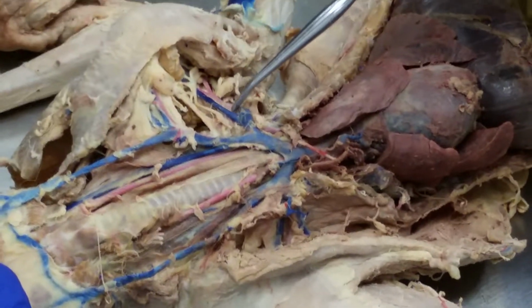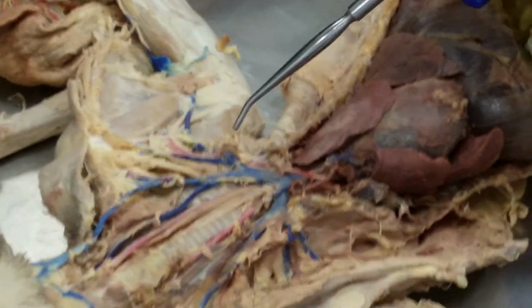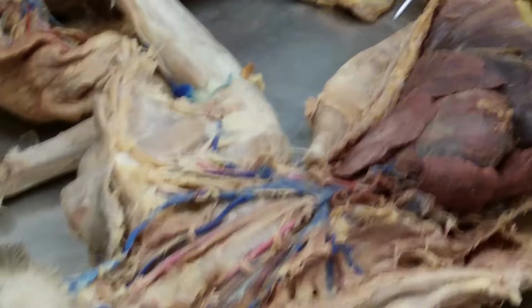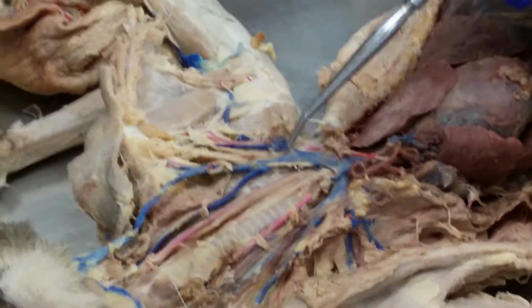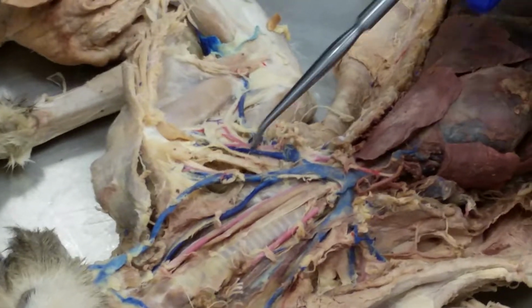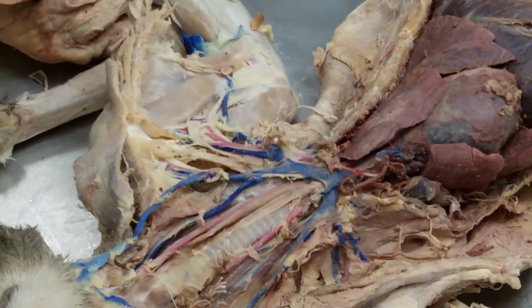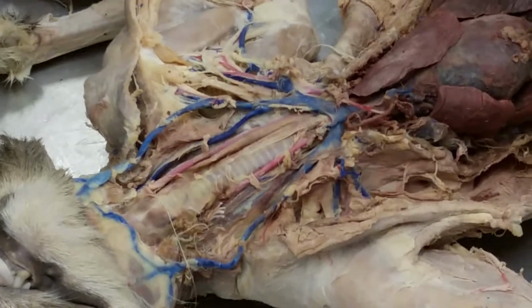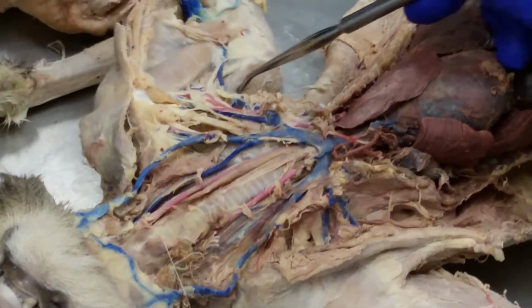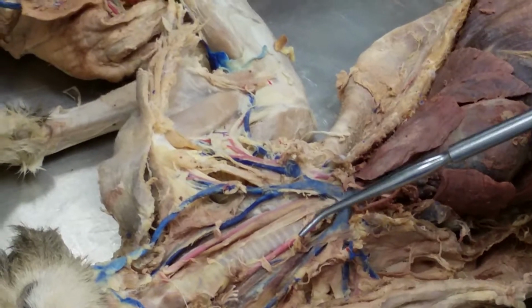Okay, and then axillary would be. We have to say left or right on subclavian now. Only on the subclavian, yeah. Arteries, the veins, no. Arteries. Yeah, arteries, yes. Okay, so subclavian vein, and then becomes axillary, and then it goes down as the subscapular artery and vein, going to the subscapularis behind the scapula, and then once it gets to the leg pit or armpit area, it's no longer the axillary artery and vein, it is now the brachial artery and vein.